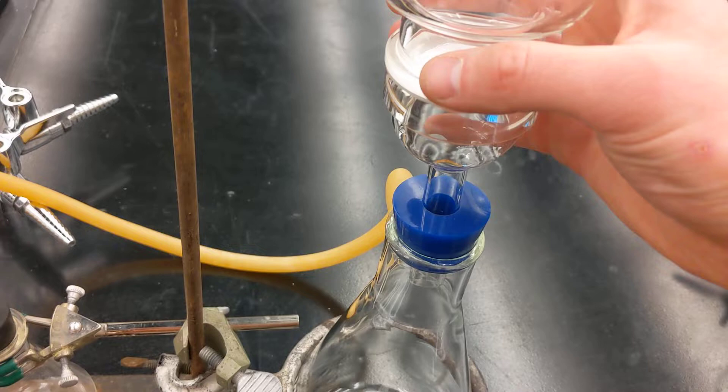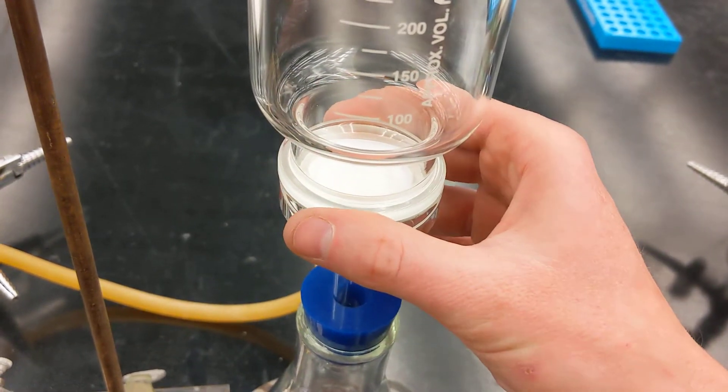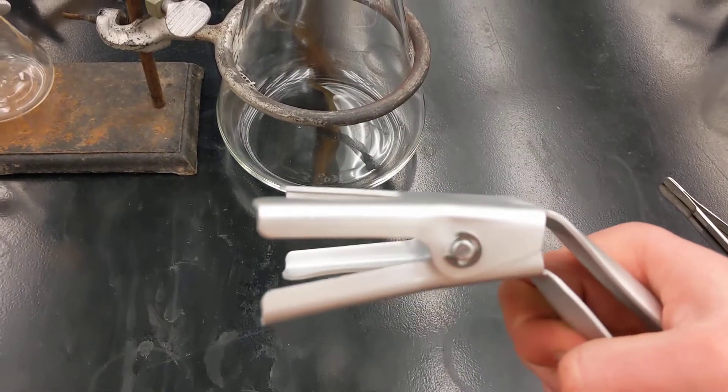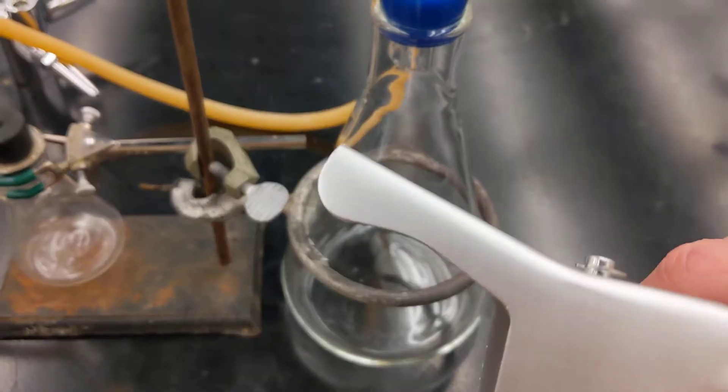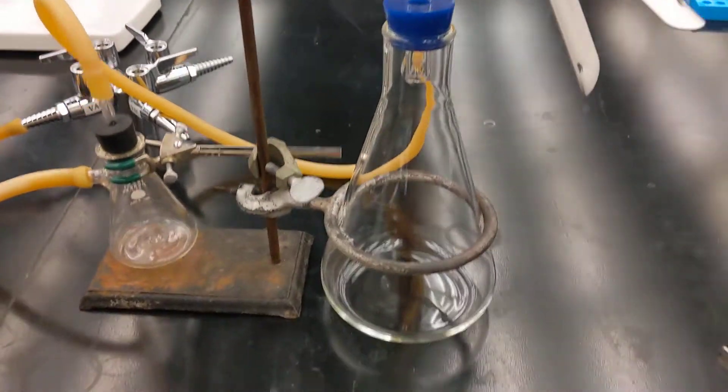It's best to do this with two hands, but I'm holding the video here. Just make sure those are aligned. Then take this clamp and open it up and hold the whole assembly together. The setup looks something like this when you are all ready to go.